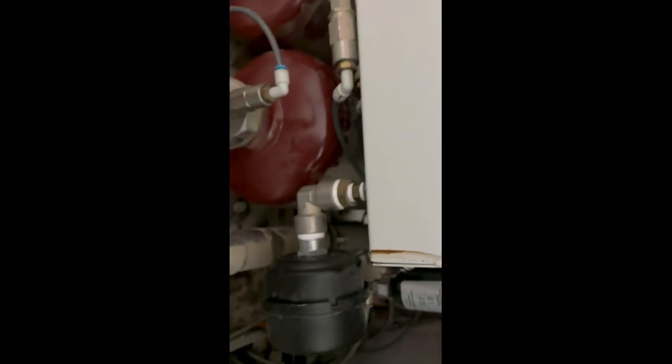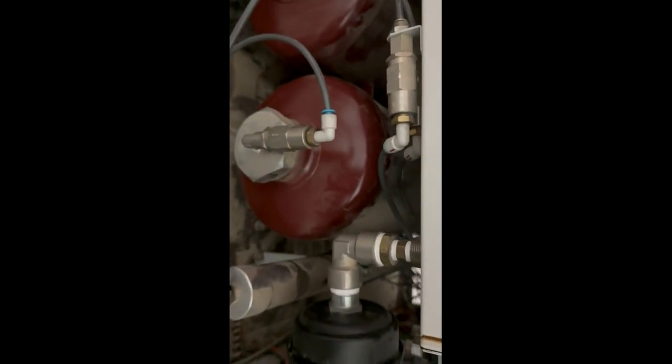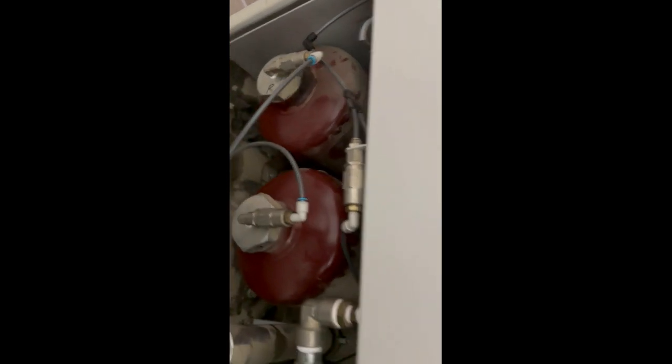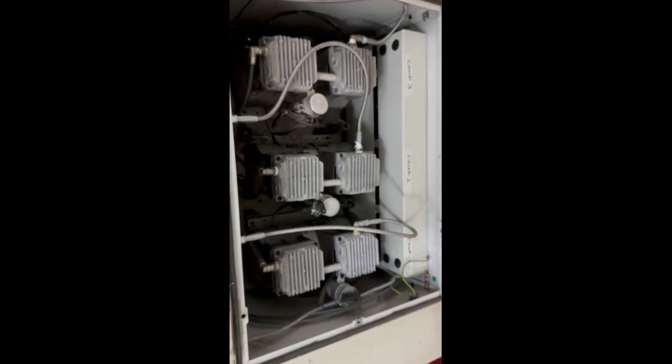Here we have the membrane, which is quite long, and here we have the drain valves and the non-return valves. In a pressure system, non-return valves are very important, and here we have the non-return valve at the inlet of the nitrogen chamber, and here we have the non-return valve for the air chamber. So that's all from our side.